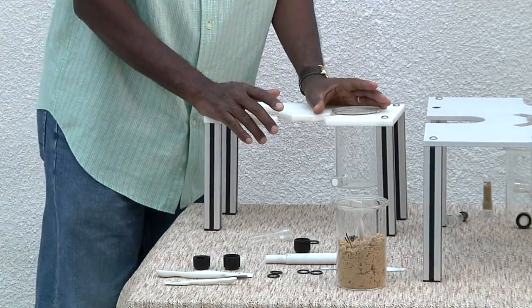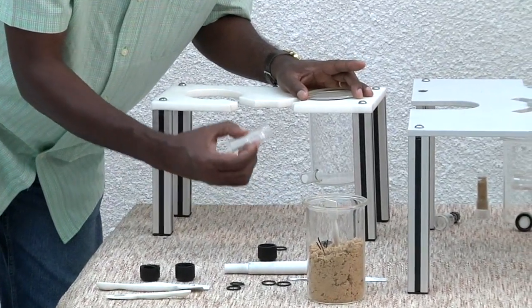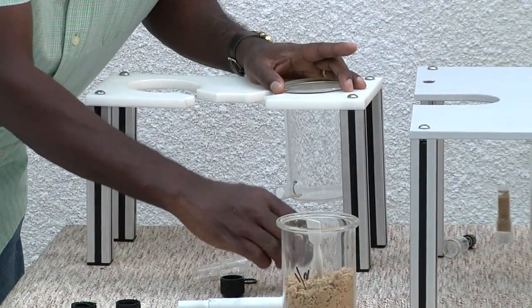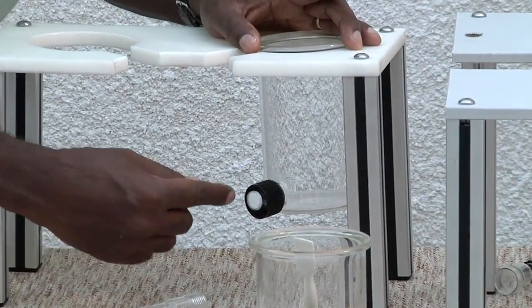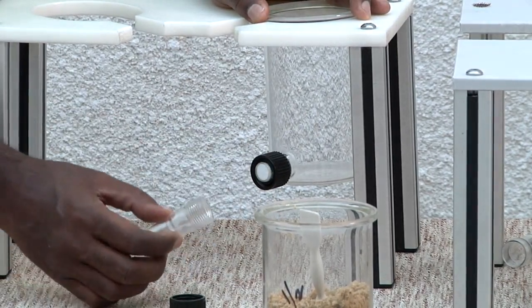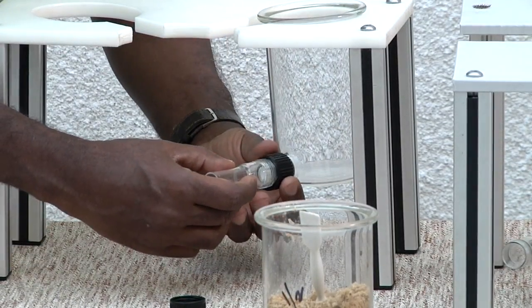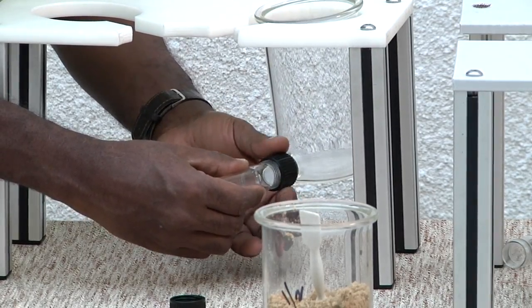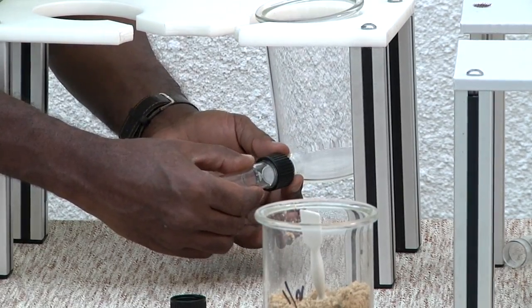Now we take the plant growth chamber and attach the nematode collection chamber, and this is how it works. We first insert the cup into the plant growth chamber, followed by the O-ring, and the next step is to attach the nematode collection chamber. Push it in, and then gently turn the black cup on and tighten it.